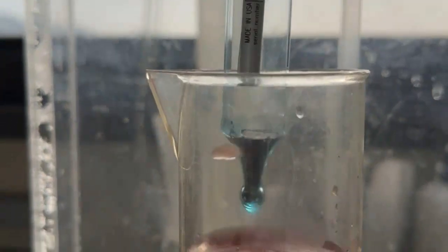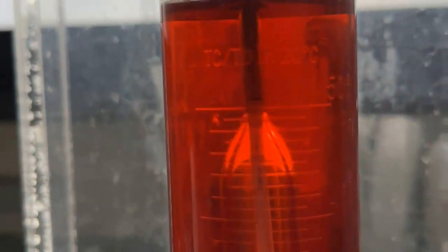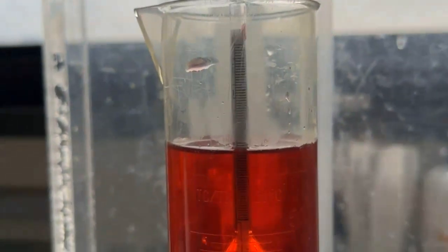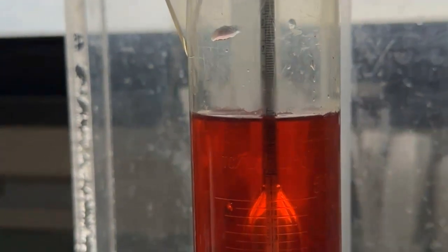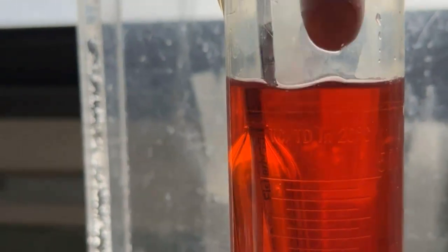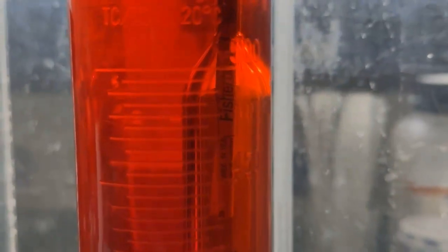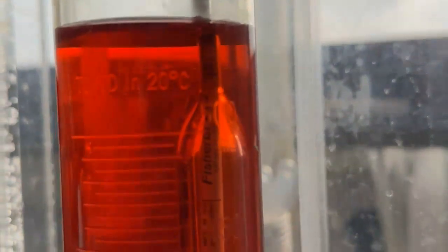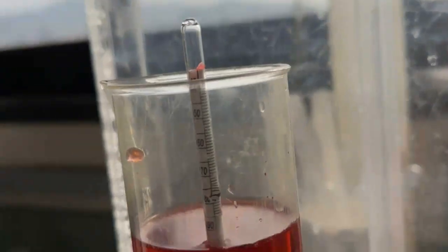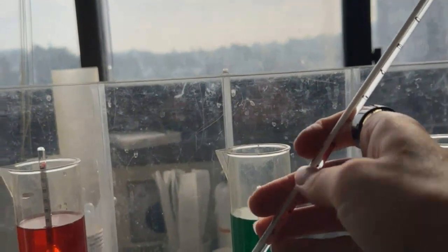And then if I go over to the warm water sample, with the same one that I did with the blue water, the cold water sample, let's see here, see what it gets to. Try to not disturb it as much as possible, get the fogginess out of there. And so this one is a little bit less dense than the cold solution. So I also just want to show the temperature using the handy dandy thermometer.